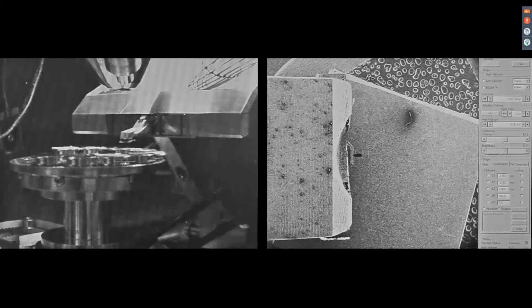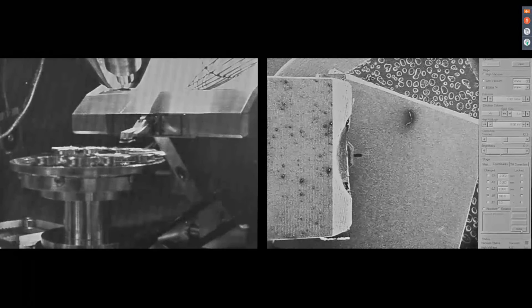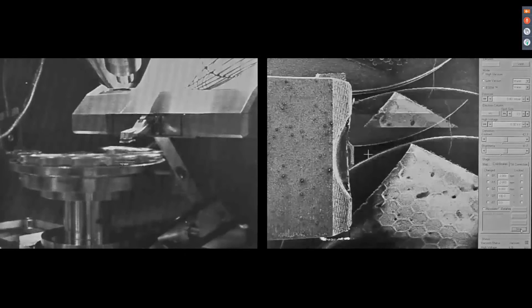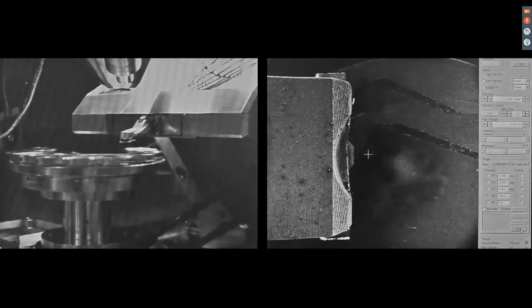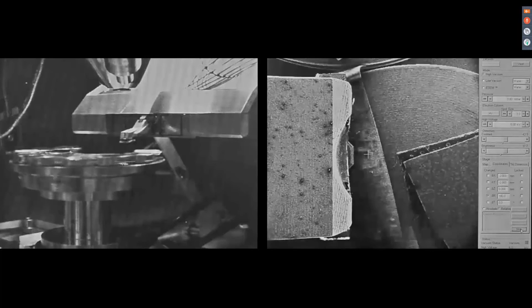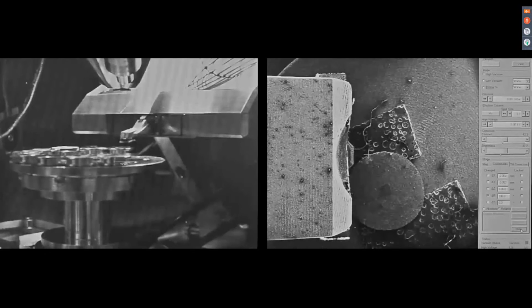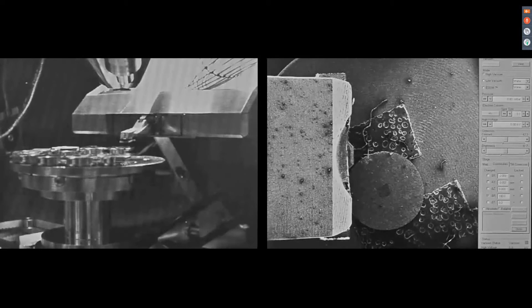Between the pole piece of the electron column and the sample, you can find the self-sensing cantilever, which means that at the moment it is in the field of view of the electron beam. And exactly this can be seen in the right part of the split screen. If I start the video now, you can see that it is easily possible to move large distances and analyze different samples, which is only made possible because the cantilever tip is the lowest point of our AFSEM system in the SEM.